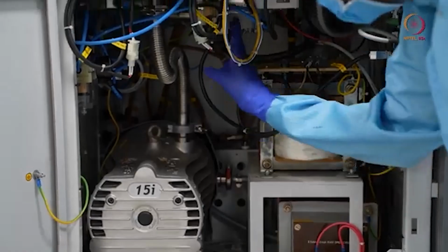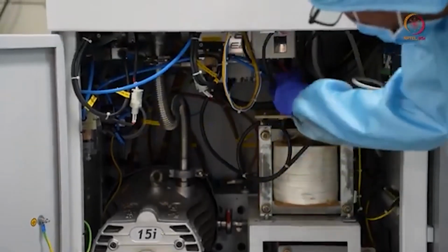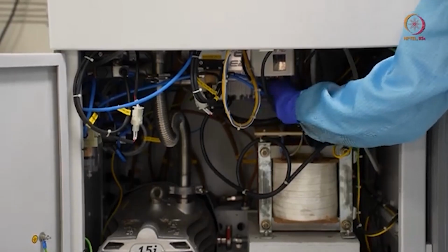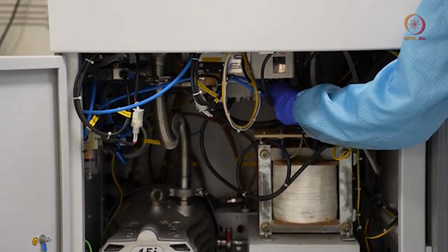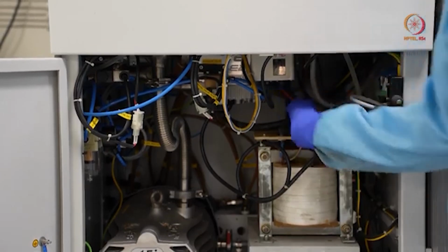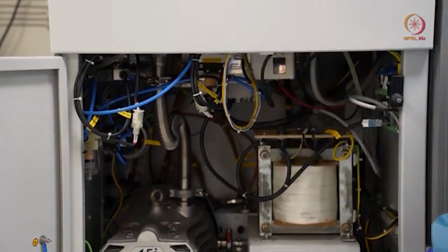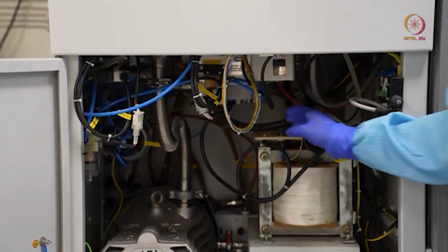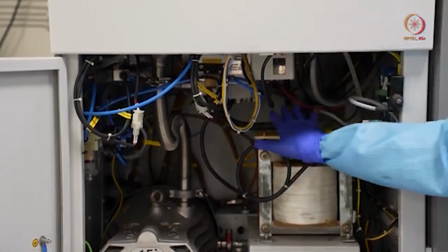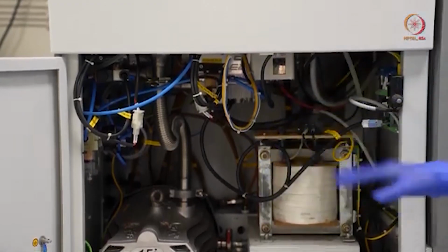So as we have shown these two valves, after that this one, as you can see, this is our turbomolecular pump. It can rotate up to 13,000 rpm, and it can drag the particles or the air in the chamber to this, and through the line there, we cannot show it from here, through that line it will take the things out.